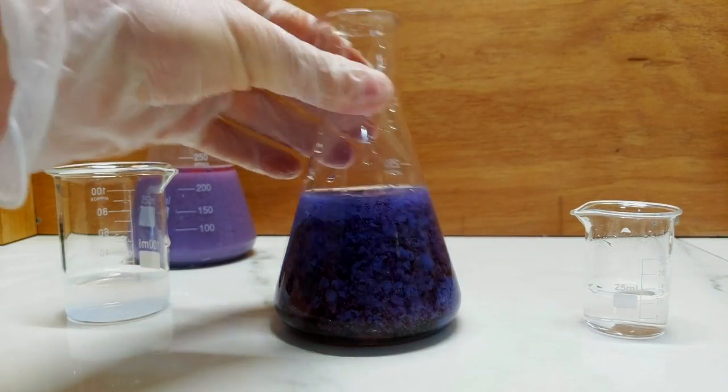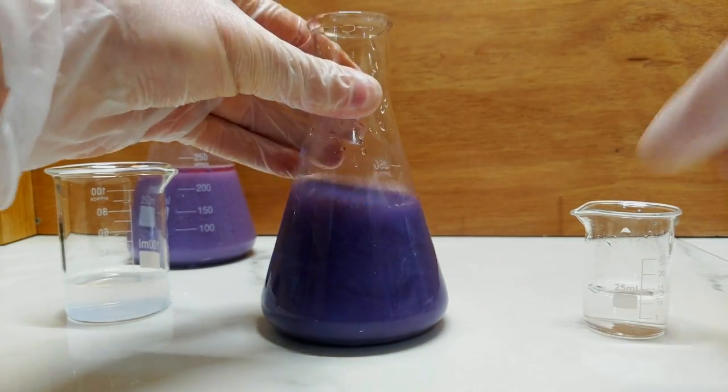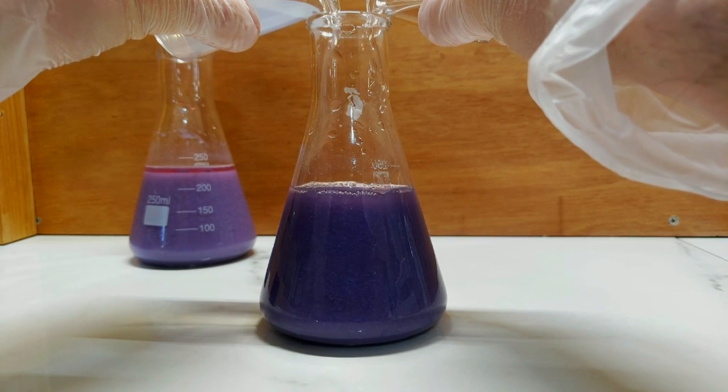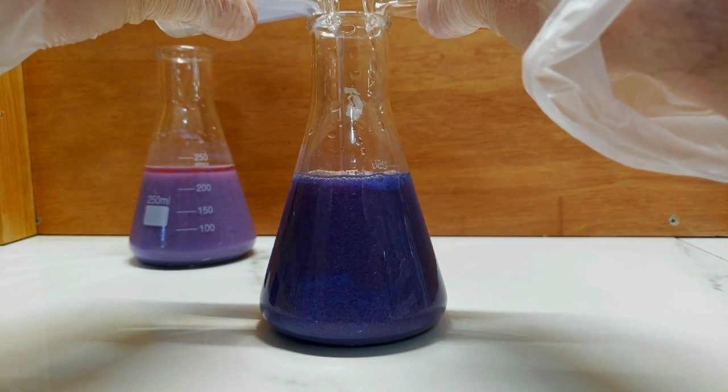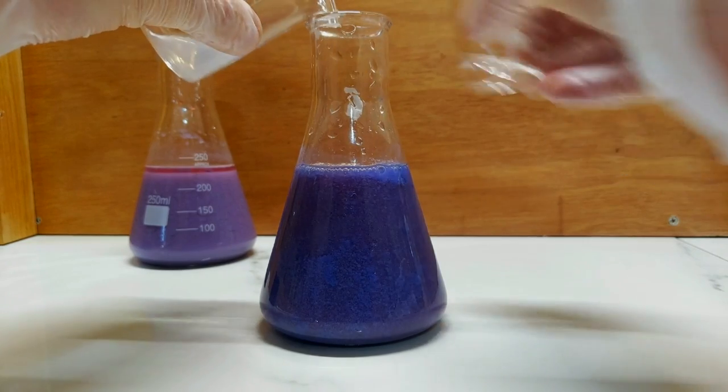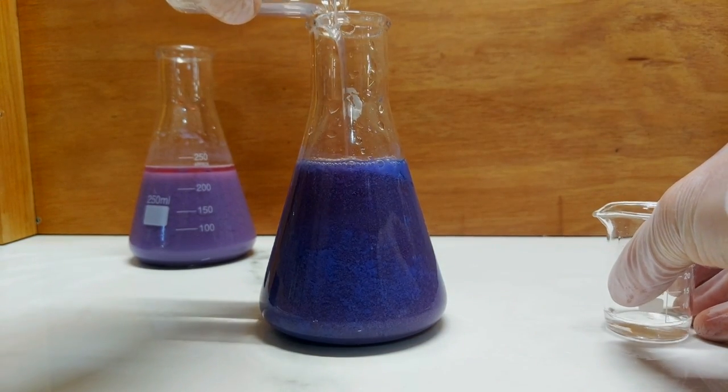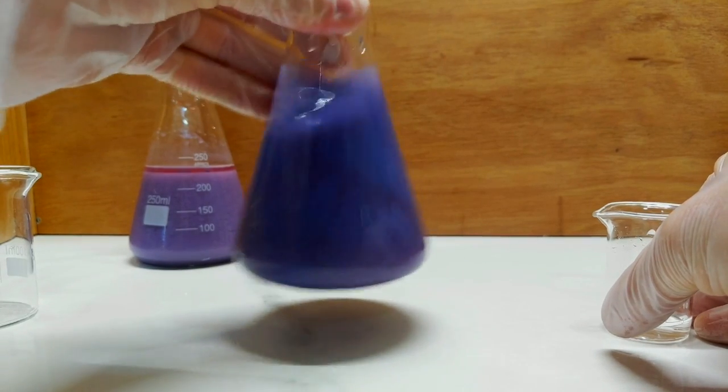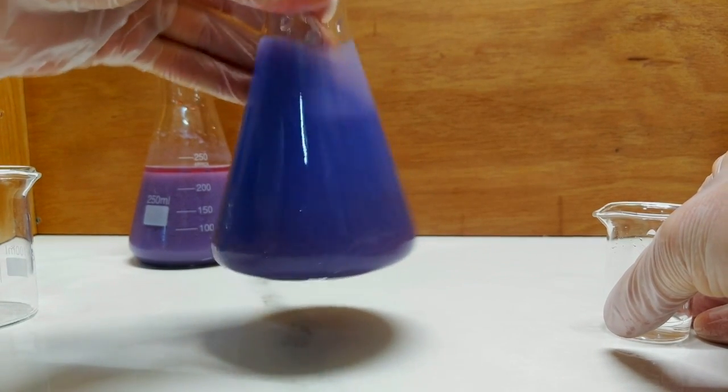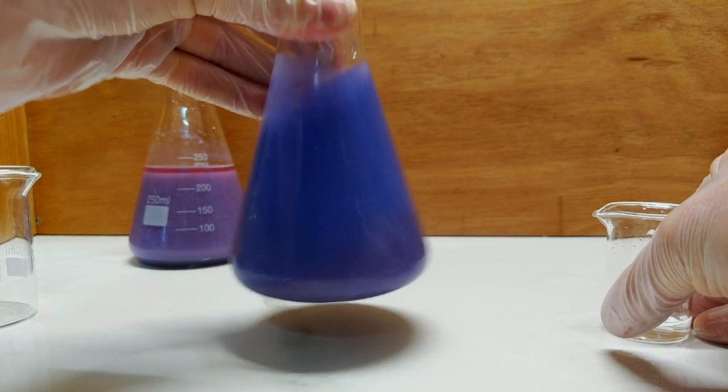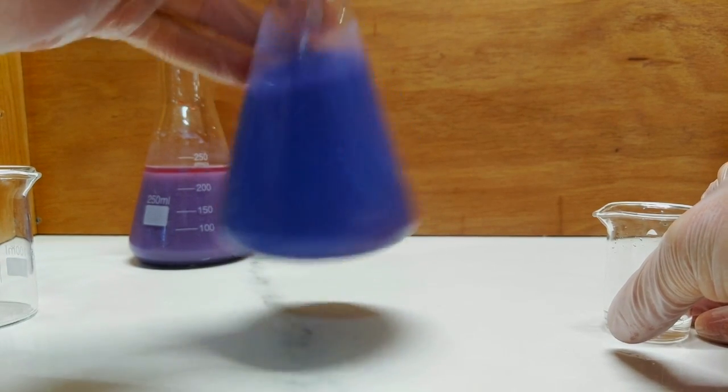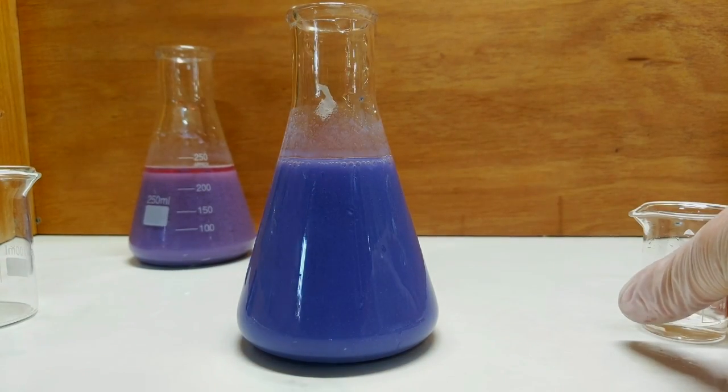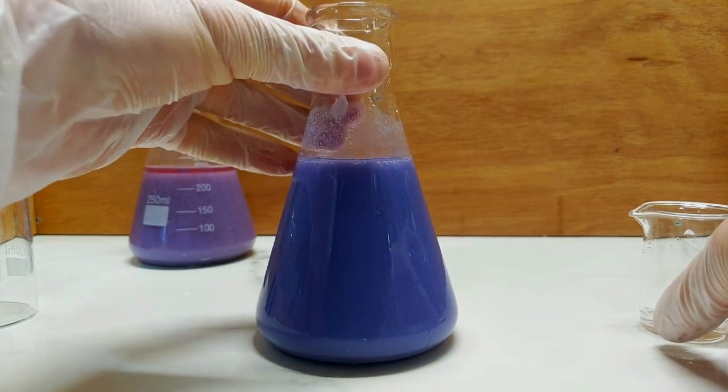Already that's way darker in colour, but we don't want to lose what we've got, so let's keep going. Definitely adding more ammonia. Give that a swirl. And I think we seem to have done it this time too. Nice. I think that worked as well.